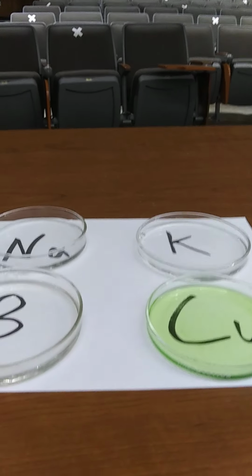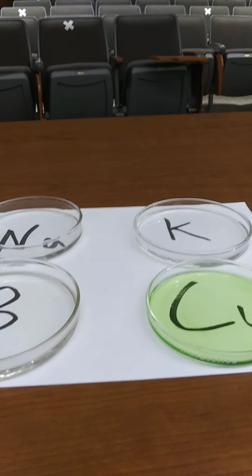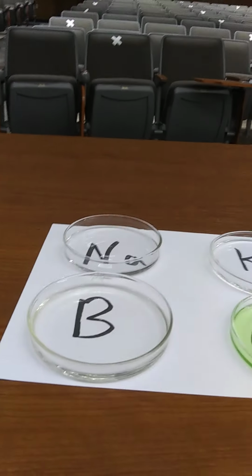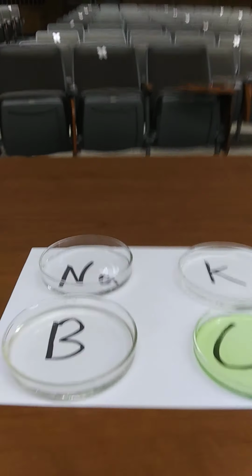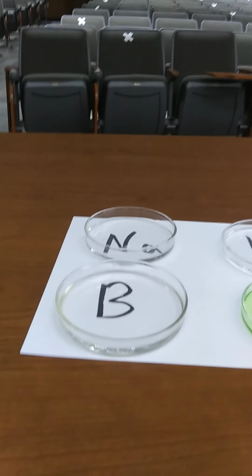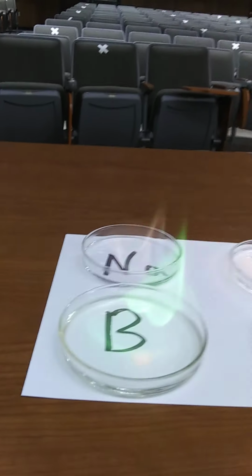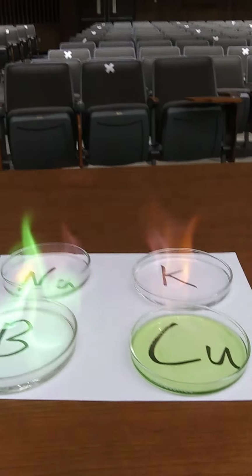And so the way to do this demo, if you ever do it, is you never bring the container of methanol with you to the classroom so that you're not tempted to do something stupid. So what's happened before is people won't think it's on fire, and then they'll add more in, and it blows up in their hands and has injured students in high schools sitting in the front row. So I'm going to light these on fire, if I can. And you'll see not a whole lot at first. And even the copper one, you can't even tell it's on fire.